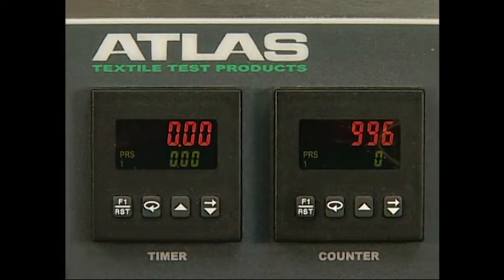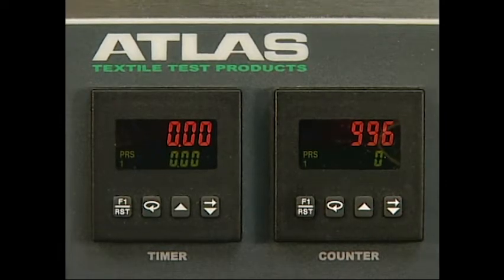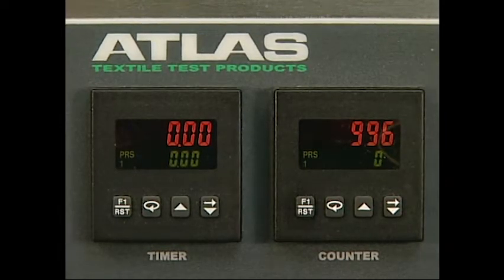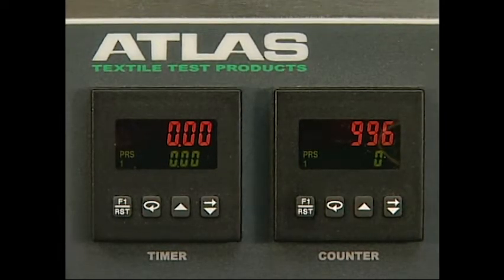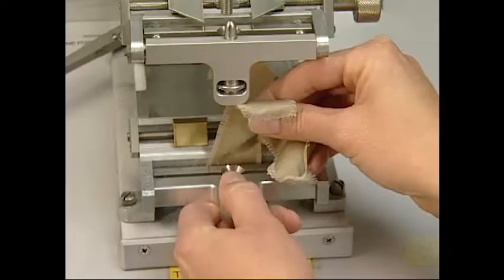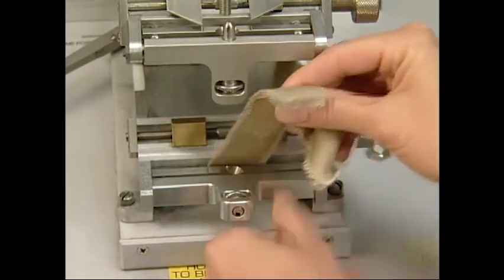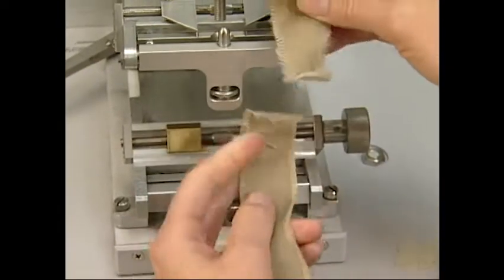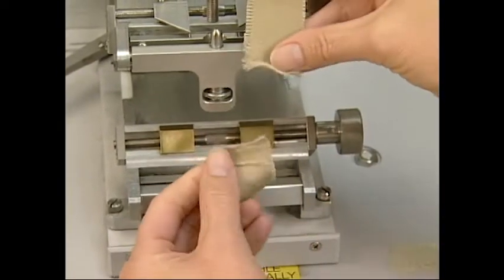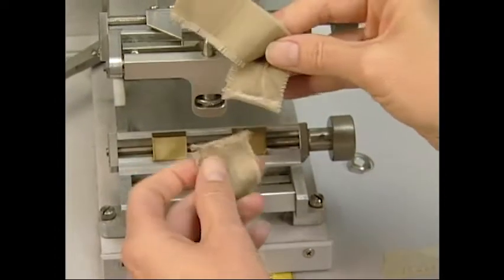Cycles to failure is one evaluation endpoint. In this scenario, the material is exposed to the abradant until a complete rupture of the construction takes place, or yarns begin to break, or a hole appears.